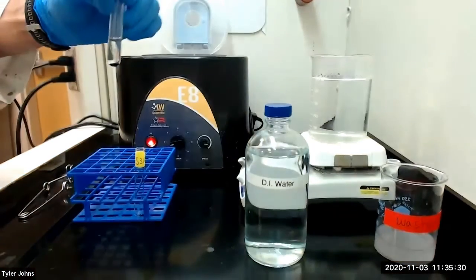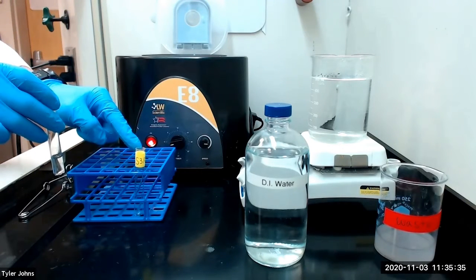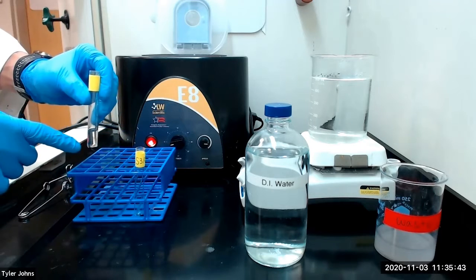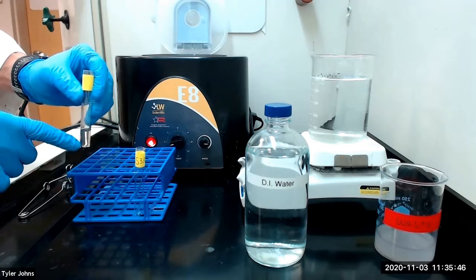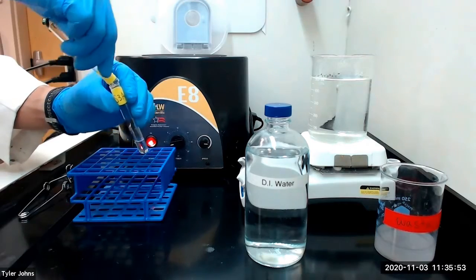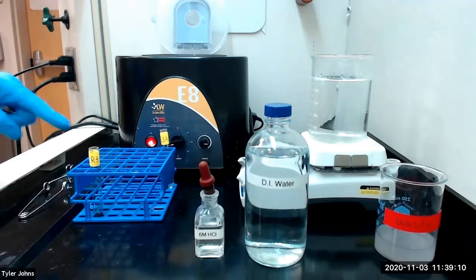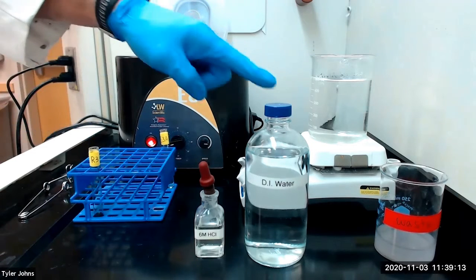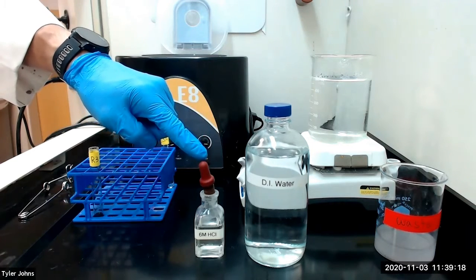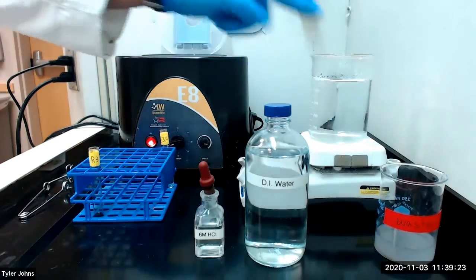We will next decant the solution into a new test tube labeled S3A and save test tube S3A for later analysis. We will then relabel our precipitate as R3 for residue R3. We will next wash residue R3 with 4 milliliters of deionized water and 4 drops of 6 molar hydrochloric acid. We will stir the mixture, centrifuge, and discard the wash solution.